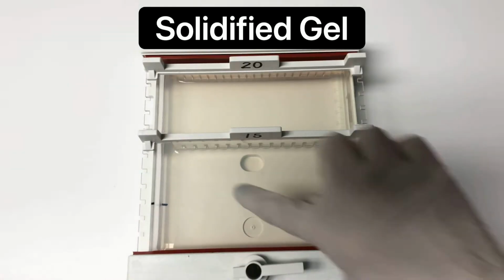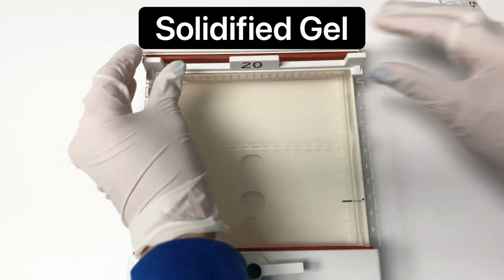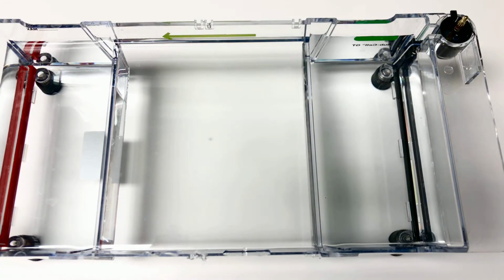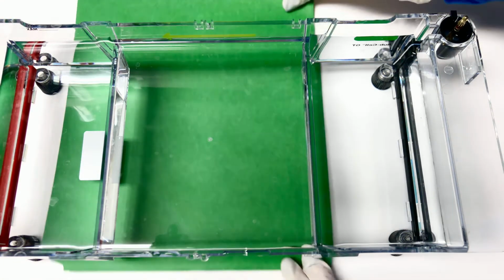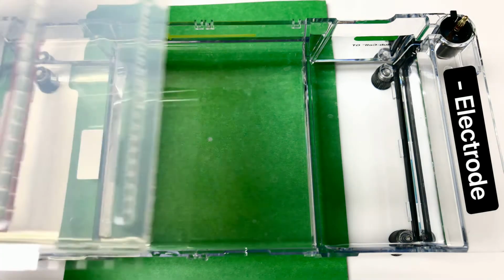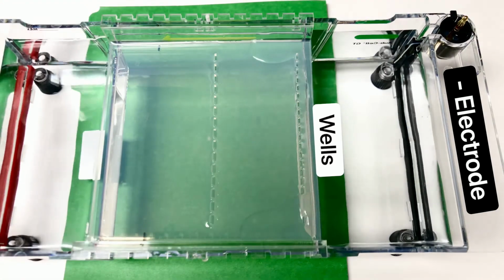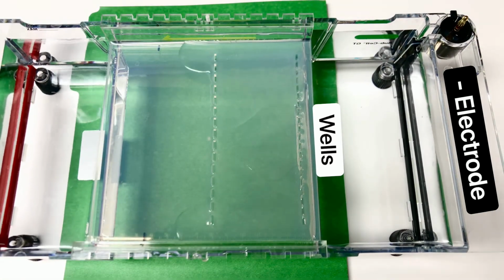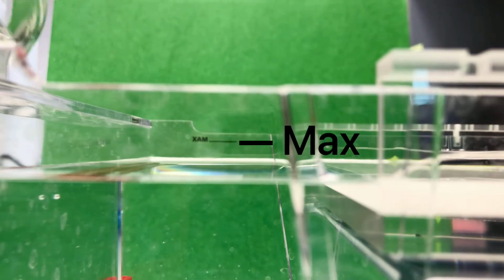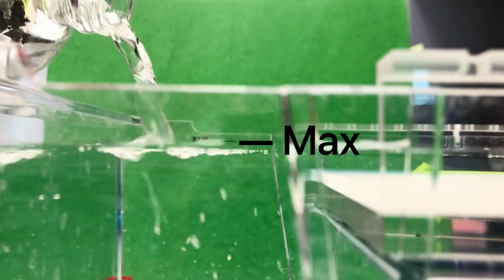Once your gel has solidified, you may remove the combs and remove the tray from the gel cast. Sometimes it may be helpful to put a contrasting color underneath the gel box so you can visualize the wells. Submerge your gel tray into the gel box. Make sure that the wells are closest to the negative electrode. You may need to add additional 1x TAE buffer to completely submerge the gel.